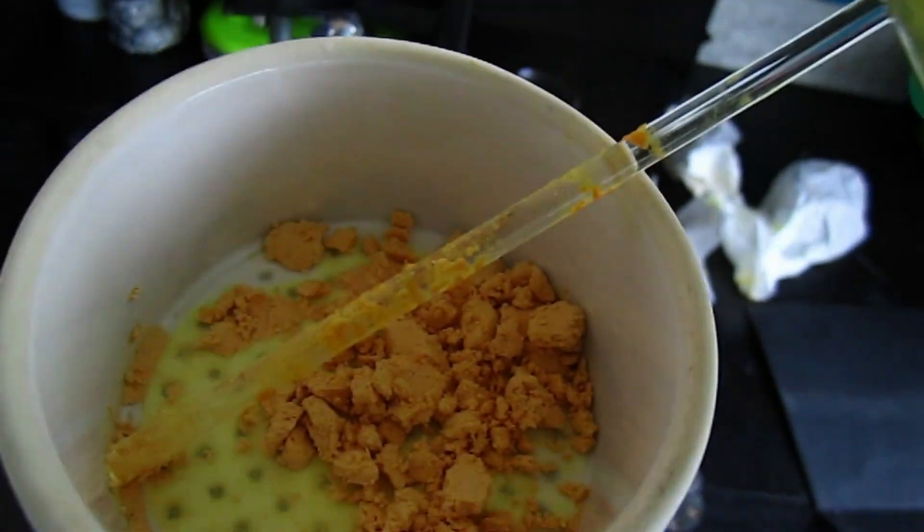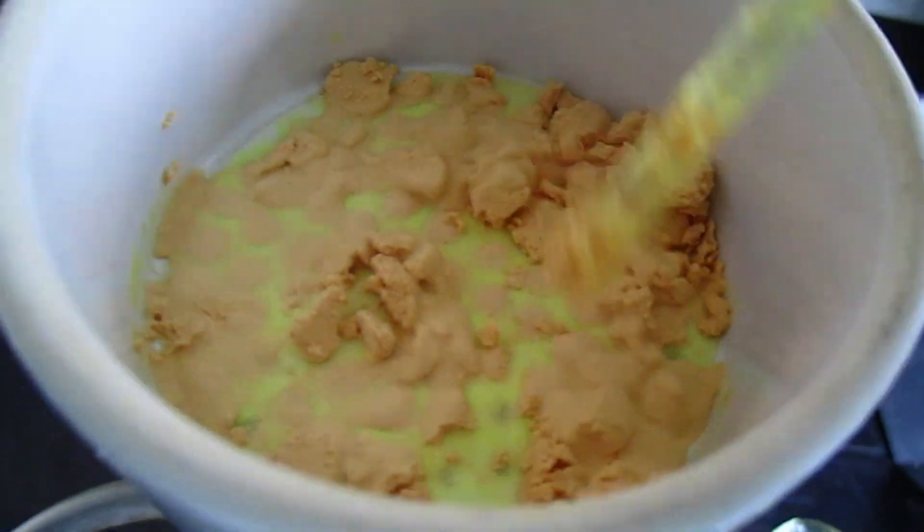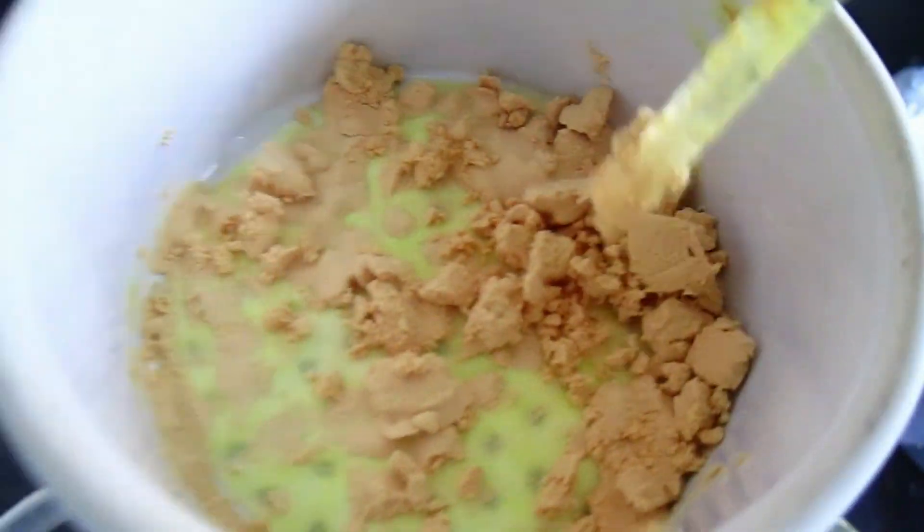Now I'm going to recrystallize it. I'm going to use water. I do not know the exact solubility of 5-nitro-salicylic acid in water because there's very little information, but I'll see if it works. I'm just going to slowly add water, and when everything is dissolved I'm going to cool it and crystallize it out.